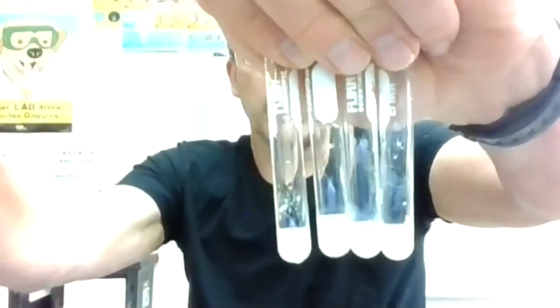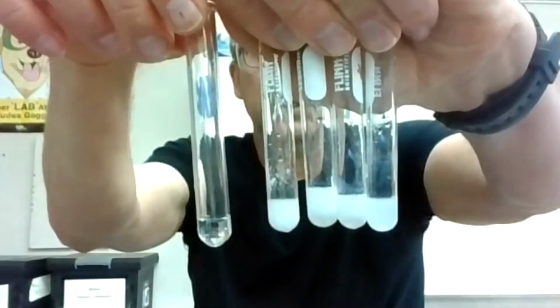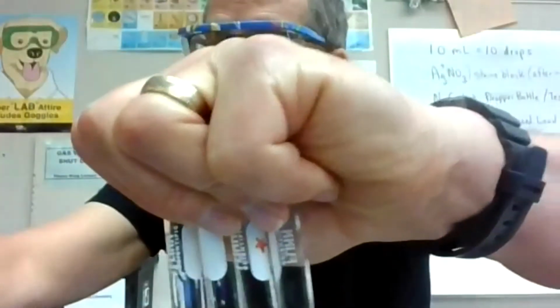Okay, compare that to a clear test tube. I think you can see a distinct difference. So it looks like we got a precipitate at each one. Looks like a white cloudy precipitate for magnesium, calcium, strontium, barium with carbonate. I'm going to go down the next column, and we'll go back to the data table where you can actually see the things and make sure you do this.